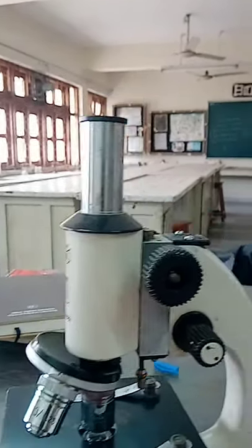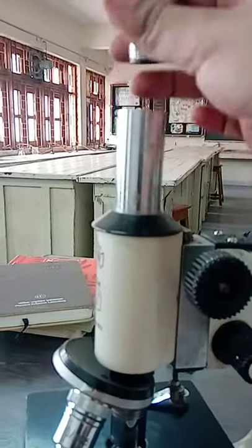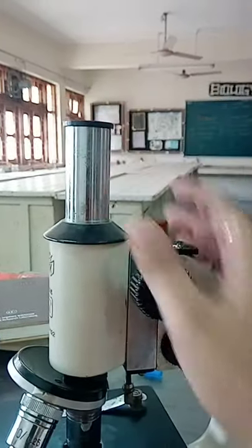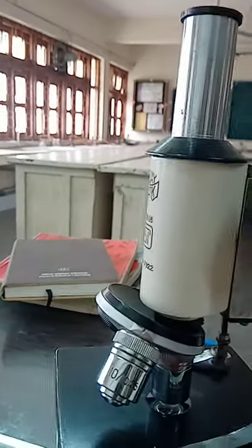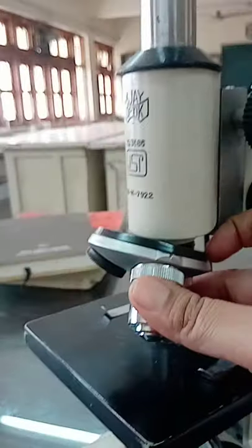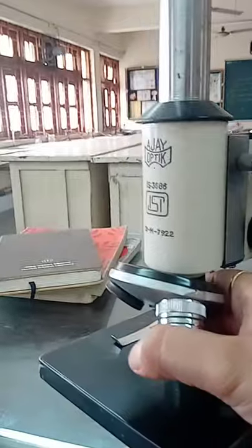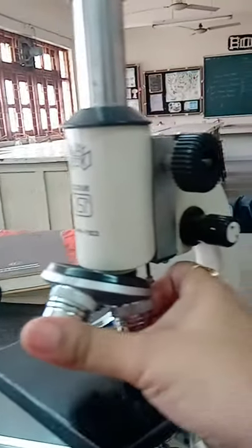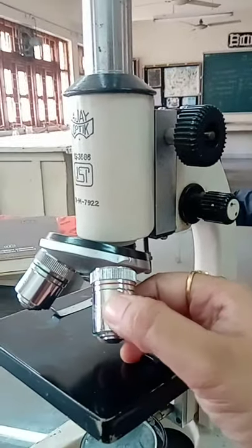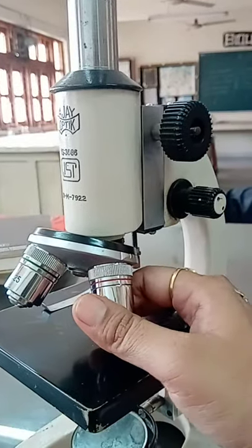There is one draw tube on the upper end of the body tube to which we can fix the eyepiece. On the lower end of the body tube, there is a metallic circular structure which is called the nose piece. This nose piece has a revolving structure to which the objective lenses are attached.